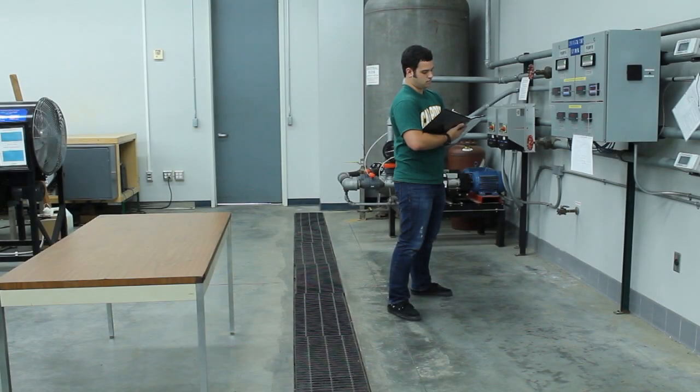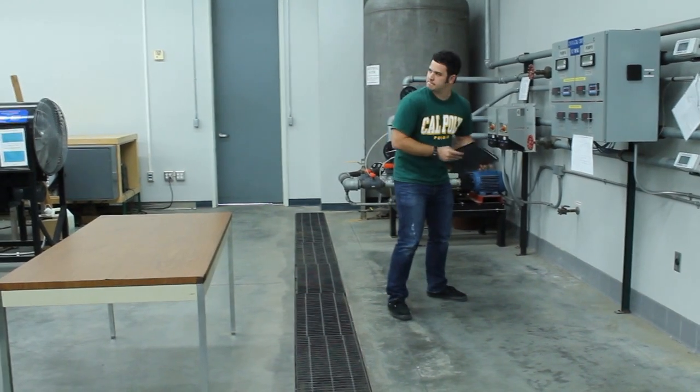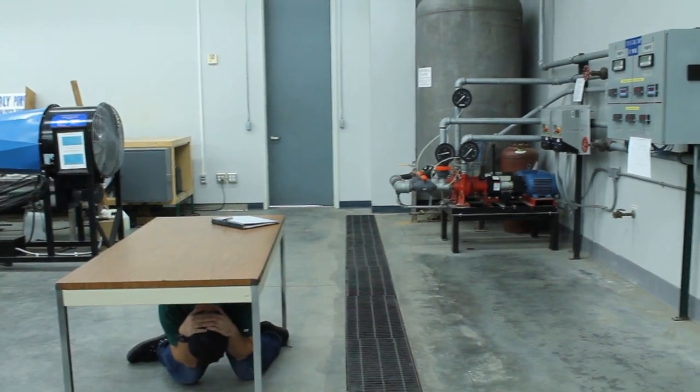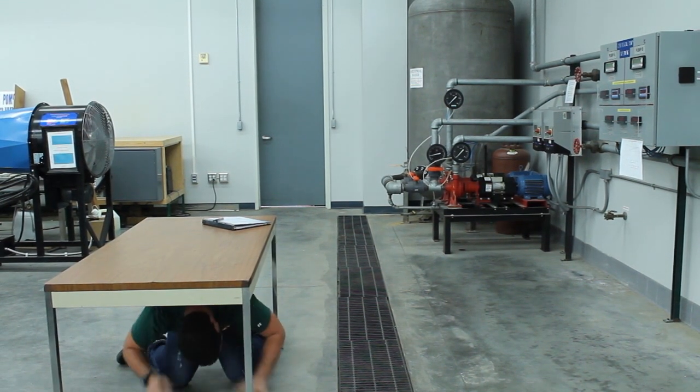In California, earthquakes are a very real threat. In the event of an earthquake in the lab, quickly stop what you were doing and duck and cover beneath a table or other sturdy structure. Once the shaking stops, calmly evacuate the building to safety.